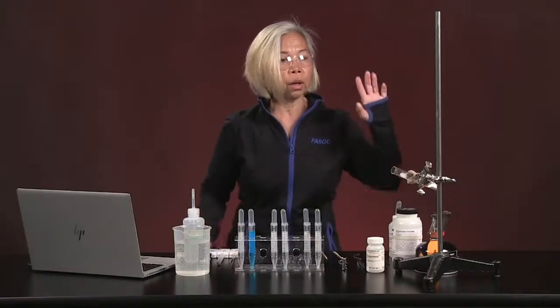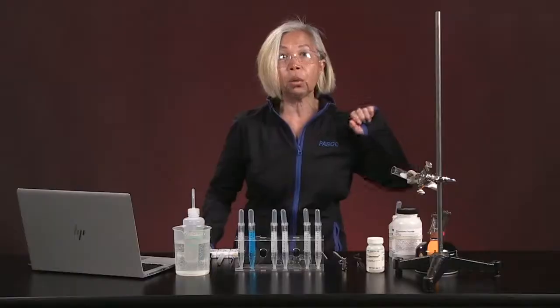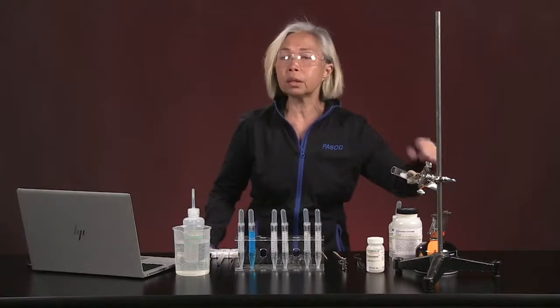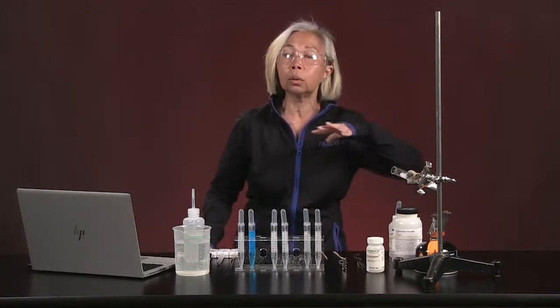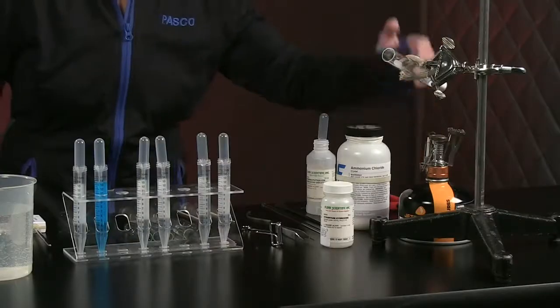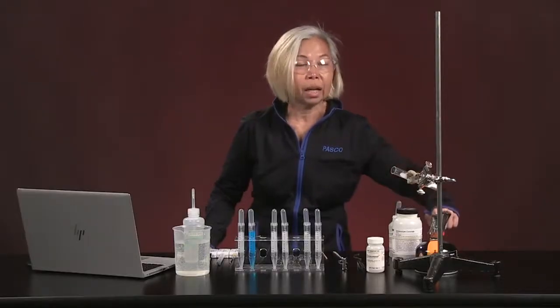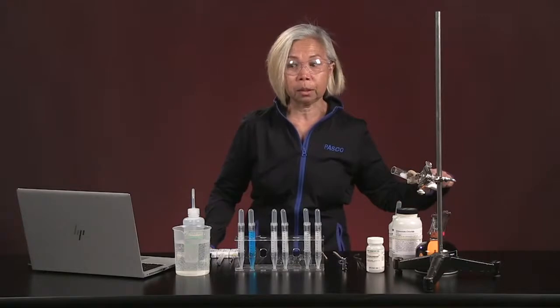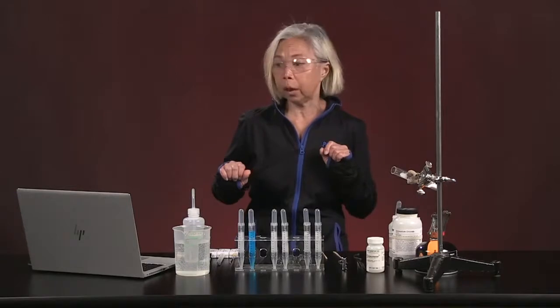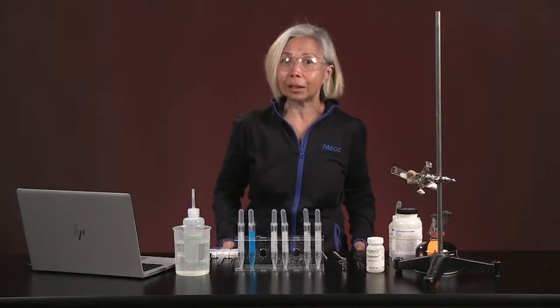Now, let me show you our other setup here. We have an iron stand with a clamp that is going to be holding one of the experiments we're running today. And instead of a Bunsen burner, and this is especially important for those of you who don't have gas lines in your facility or are working from home, guess what? A camp stove, $7.50 on eBay, is the perfect alternative to that Bunsen burner. We always have wash bottles and buckets of water available to wash any of our instrumentation. And that's essentially what you need to get this lab set up.